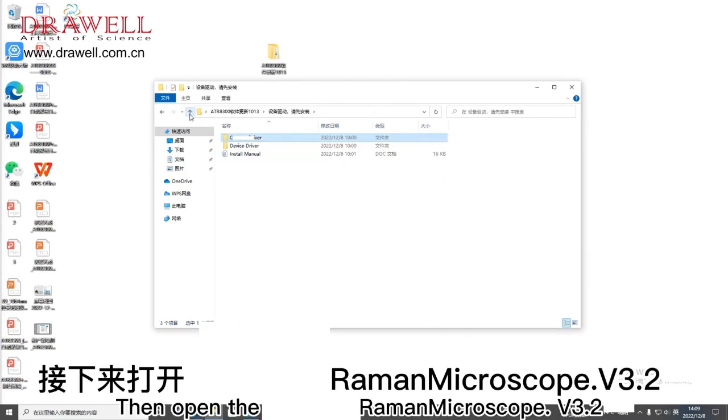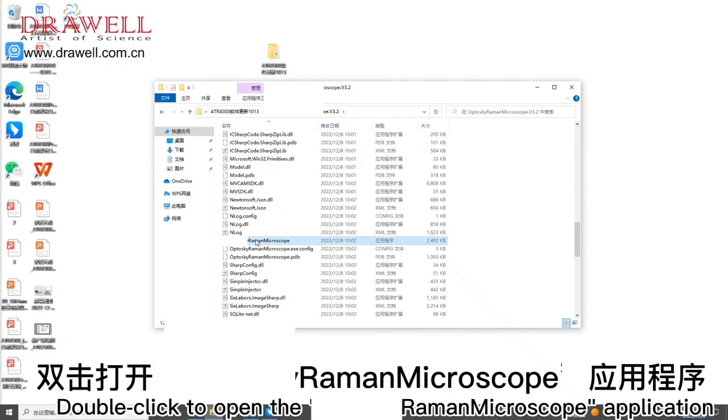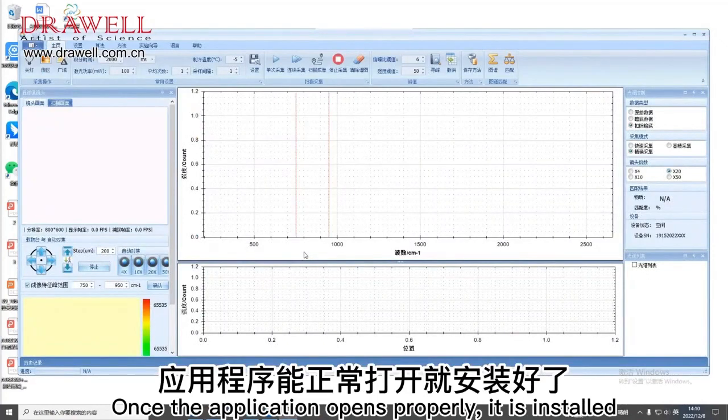Then open the RamanMicroscope V3.2. Find the OptoskyRamanMicroscope app. Double-click to open the OptoskyRamanMicroscope application. Once the application opens properly, it is installed.